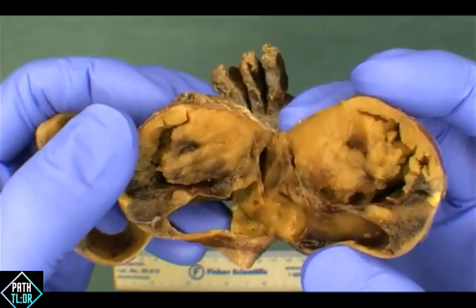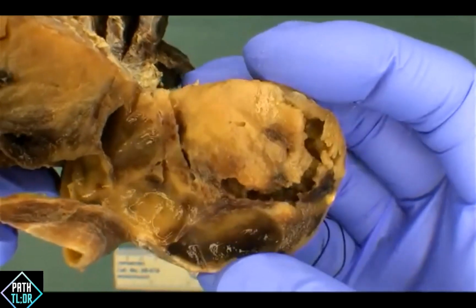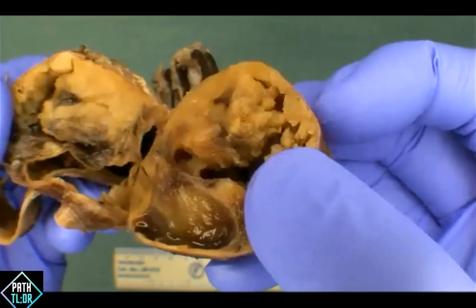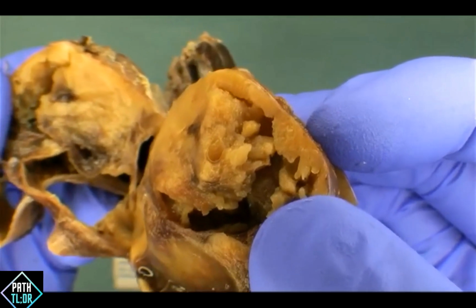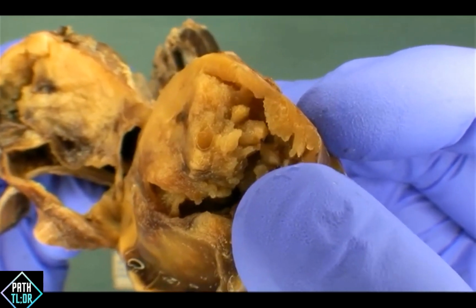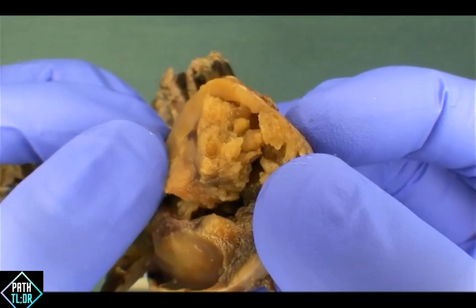And I think when I took the specimen out and was starting to prep it, I thought, okay, sure, fine. But as I started cutting across it, these more solid areas really caught my eye. And you can see how solid it is. It's got this very fleshy appearance, which made me a little bit worried in terms of what this could be. And then again, if you look through here, what are those? In the chat. Yeah. So this is a nice example of how we would use the word papillary to describe some of the features of the gross specimen, right? And papillary really refers to these things sticking out off of the surface, that textured part of the lesion sticking up. So a nice example of using the word papillary to describe what you're seeing.